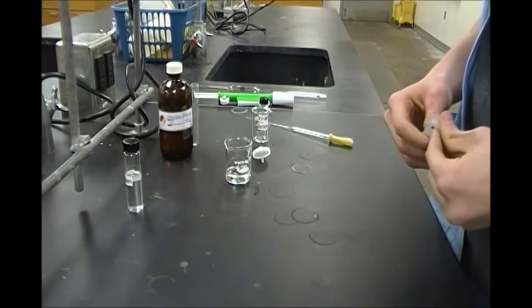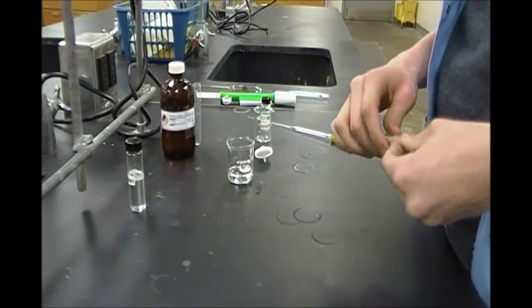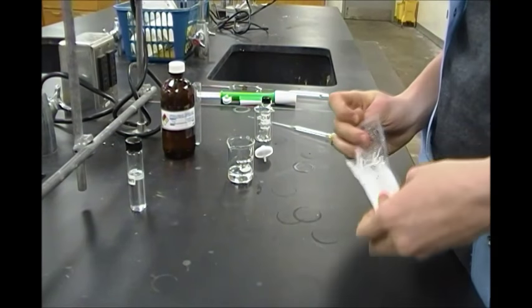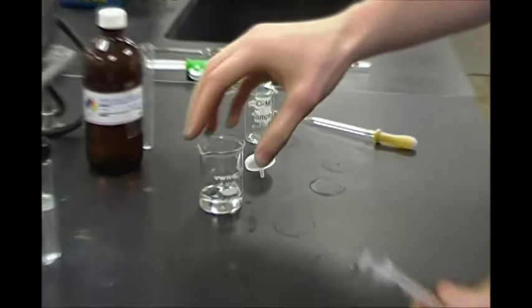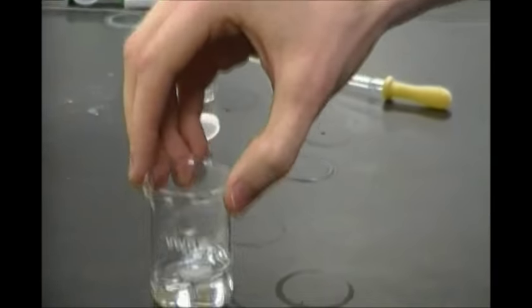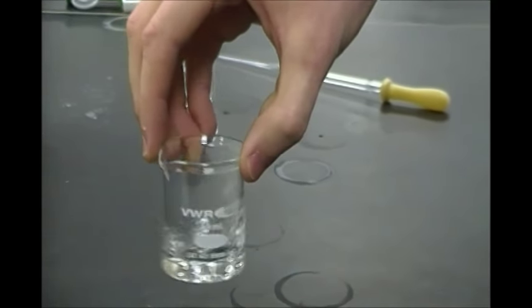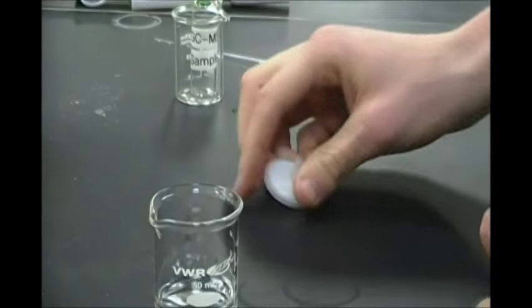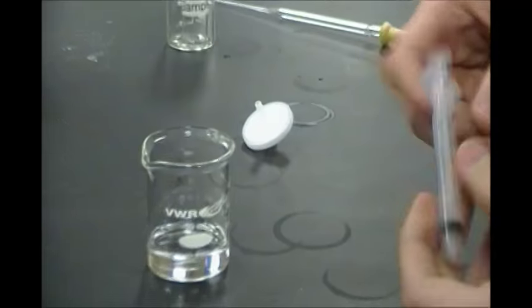So the next thing we're going to do is filter the sample that we just created. So here's our sample that we just made. We're going to filter it.